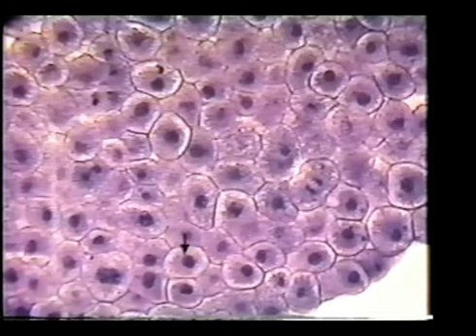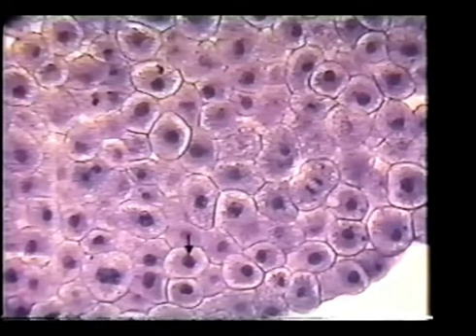The nucleus is very clearly defined, and you can see almost the nuclear membrane that surrounds it. You do not see chromosomes inside the nucleus. The nucleus is dark because the chromosomes are still in long, thin strands called chromatin threads, or chromatin. On this particular cell, we can't see the centrioles, but under your microscopes, you may be able to see these two little dots outside the nucleus.